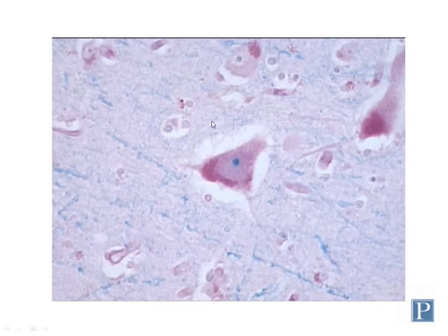So here's a high magnification view of the gray matter of the cortex, and here you can see a number of different cell types. The one cell type we're going to focus on in the cerebral cortex this week is this type of large multipolar neuron, which are called pyramidal cells or pyramidal neurons. You can see here they get their name because of their roughly triangular or pyramid shape appearance. These pyramidal neurons usually have large visible nuclei. Here you can see the nucleolus of a nucleus and a little bit of the nucleoplasm around that.